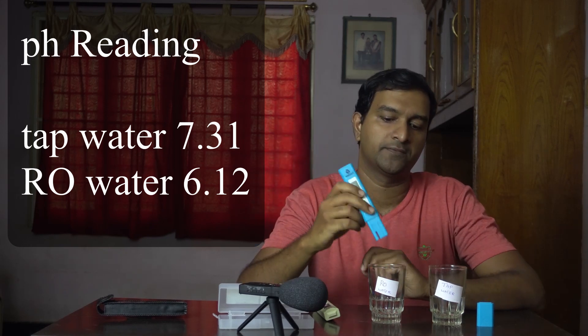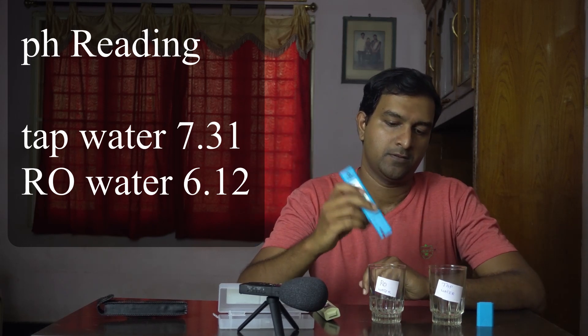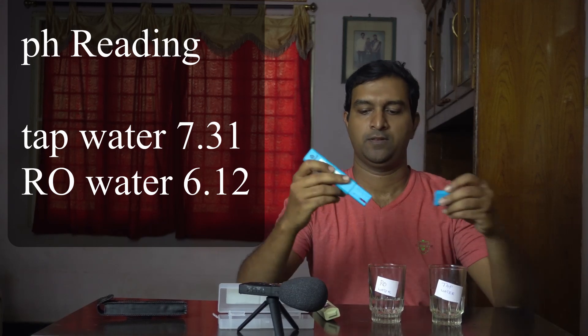So with this meter, it is very easy. These values are within the same range. I'm going to use these values as well. It is a very useful tool. If you want to check water quality, you can use these values.